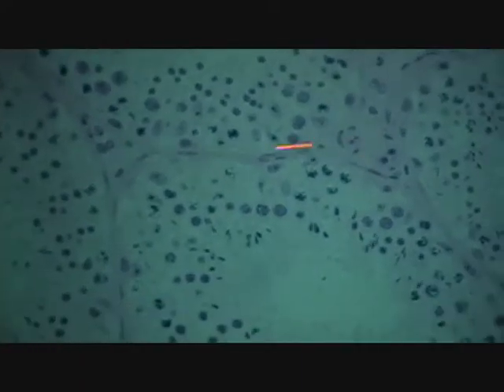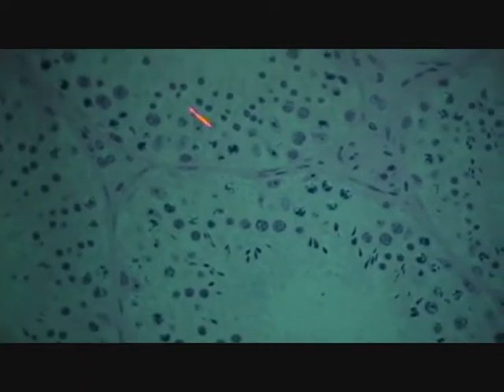Structure becomes unmistakable. All these cellular changes happening. Lots of dynamic cytology going on here. So these are the seminiferous tubules. Two most complete ones right here, and then parts of ones over here.